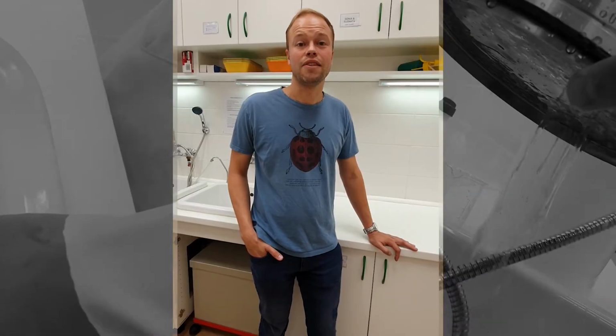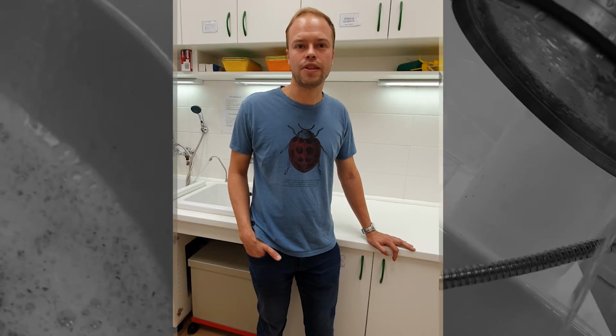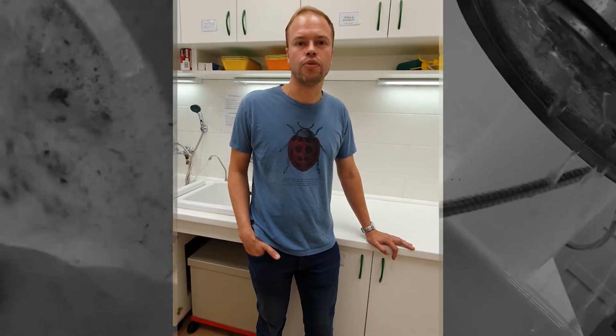I was asked to create this video on how to perform the lab techniques so that it would be easier to understand and adopt by new students. So in this video I will show you which materials you need, take you through the procedure step by step and give some additional comments during some of the steps.